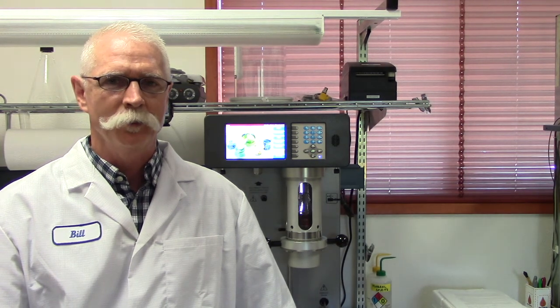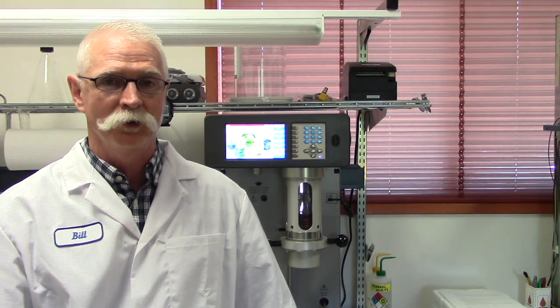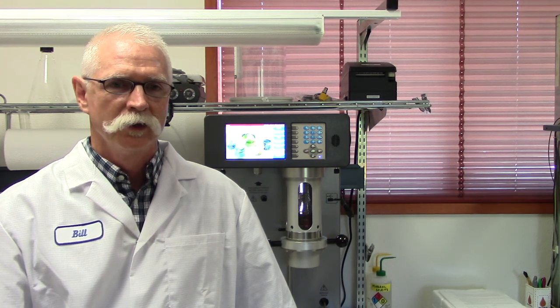Plus. The purpose of the following video is to instruct the user on how to set up a sample, batch, and/or lot ID naming convention that will be assigned to your particular sample recipe. We hope that this video is informative and helpful.